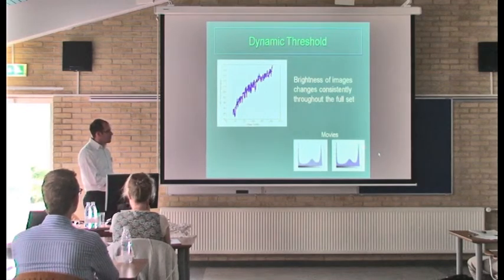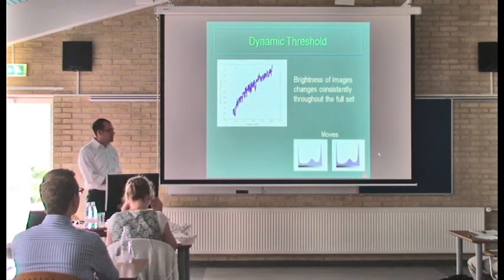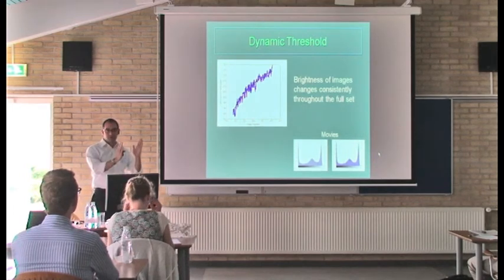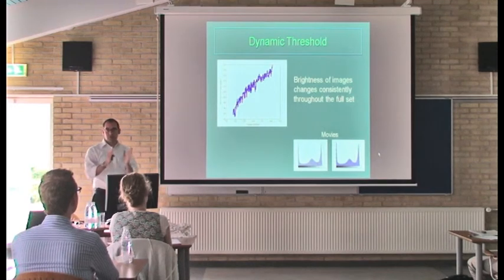Scott developed a program that basically fits these 2 curves to a polynomial, and then sets the threshold based on the histogram for each image. And so you can see as the histogram shifts over, these threshold values shift. We call this dynamic threshold. So basically it adjusts to the quality of each image.